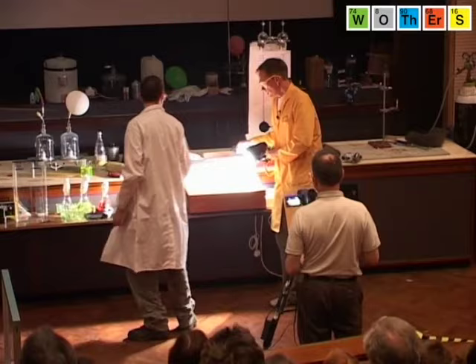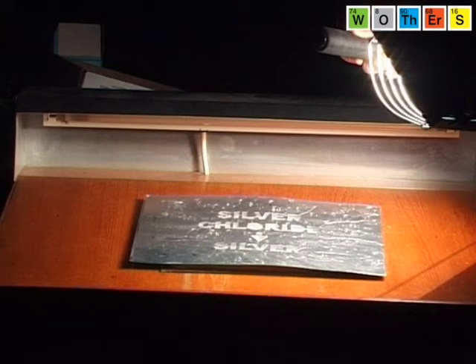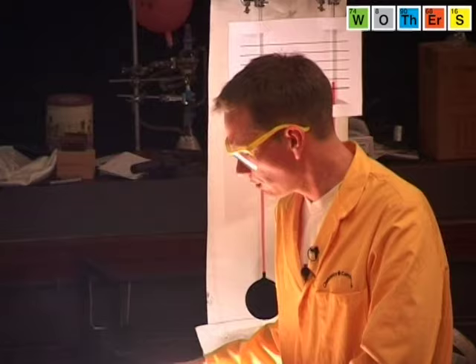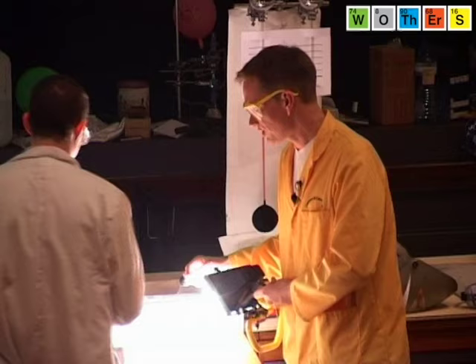So, we have the white silver chloride. We're shining the light onto this now, and the light is causing a chemical reaction. The light breaks down the silver chloride and forms some silver particles. Now, these are a very different colour from the silver chloride. The silver chloride is white. The silver itself — silver is a metal and slightly metallic coloured. We should be able to see some of the silver being formed in this reaction, so we just need to give it a decent amount of time in order for it to react.